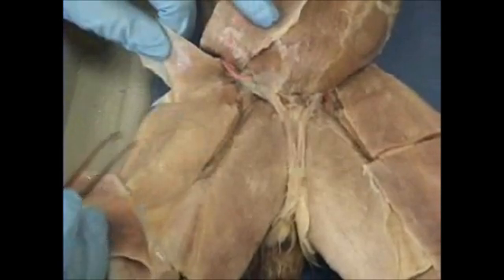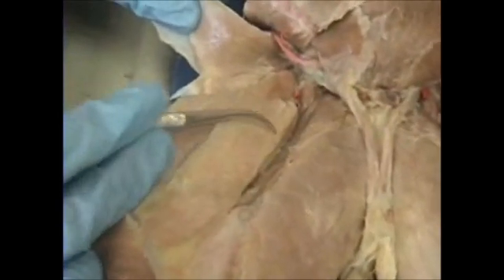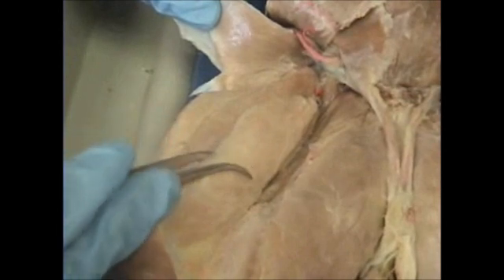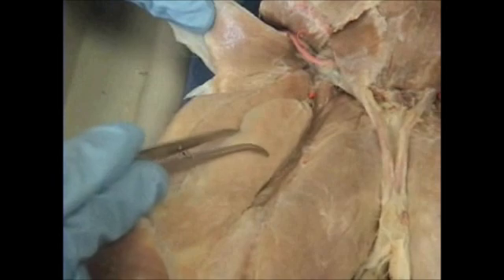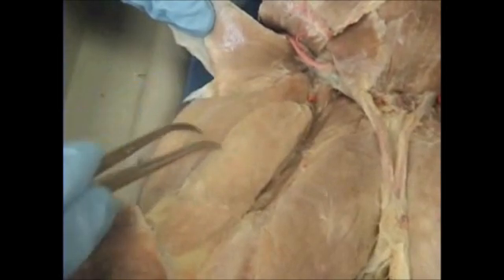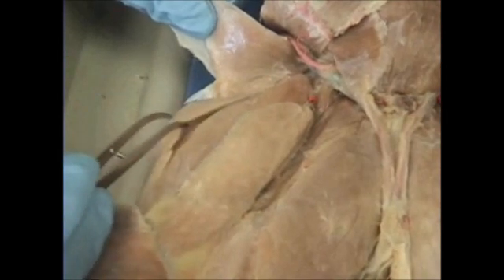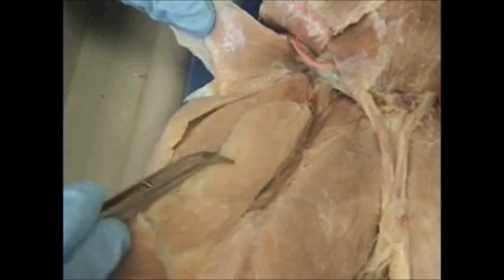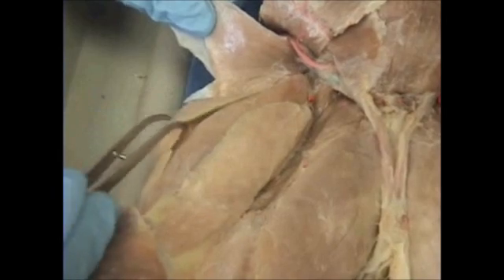We see the muscles of the upper thigh, which are called our quadriceps. Quad means four, so you know that there's four muscles. Here we have our vastus medialis muscle. In the center, this whole muscle here is our rectus femoris. So the most lateral position, we have our vastus lateralis. Vastus medialis, rectus femoris, vastus lateralis.